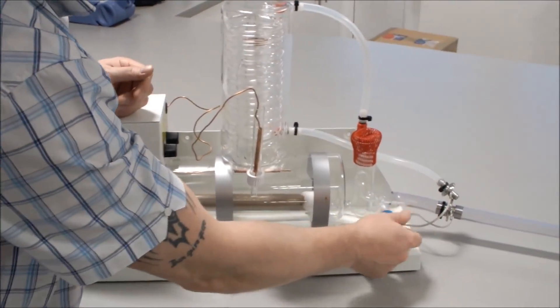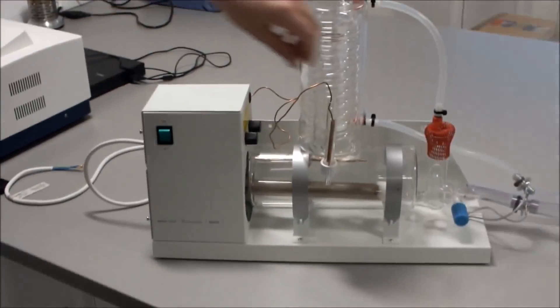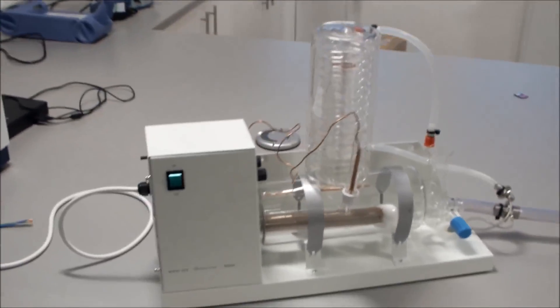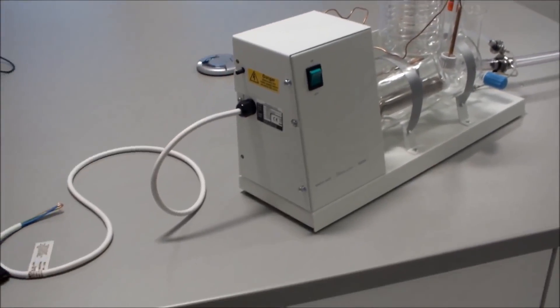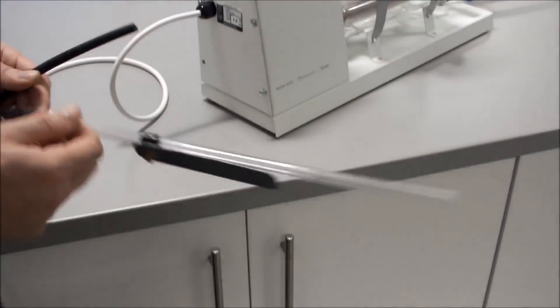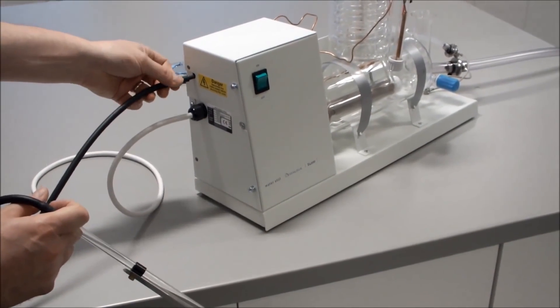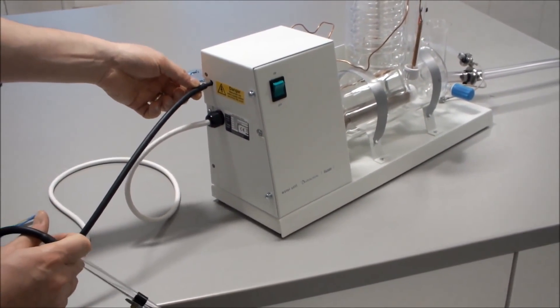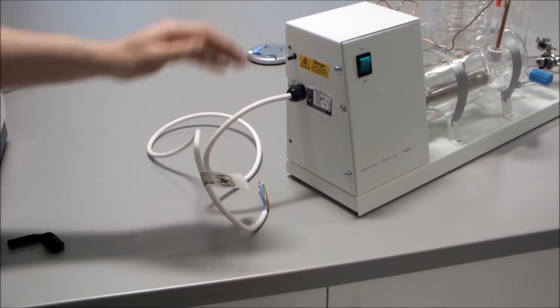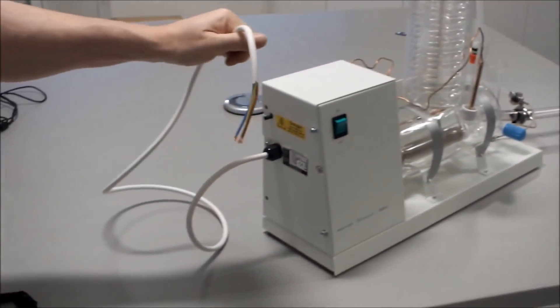To drain the water, open your stopcock — the water will drain out via your drain — then close the stopcock. When the unit is together, don't forget to remove any covers still on there, especially the red one off the funnel. When you've leak-checked the unit, connect the reservoir water level sensor, which consists of a black hose with a glass bell that goes into your reservoir. The tubing connects to the pressure switch. You can then connect your electrics — this should be done only by a qualified electrician. This is a permanently connected unit, so it needs to be permanently connected to the mains, not via plug.